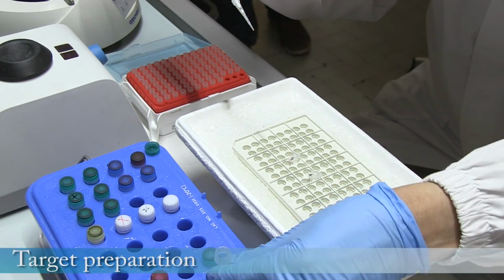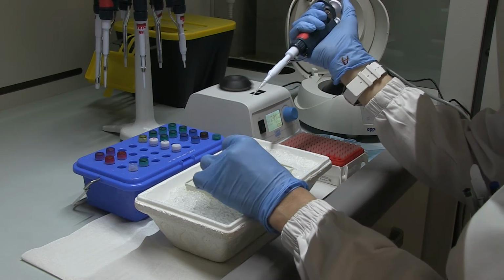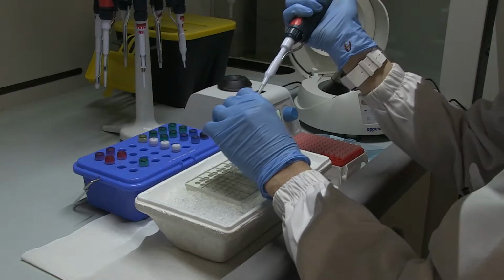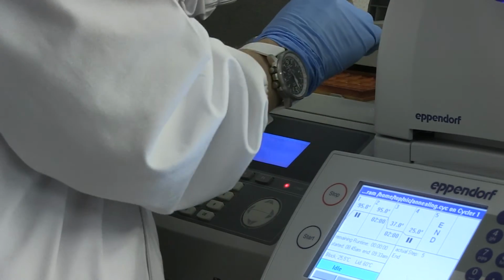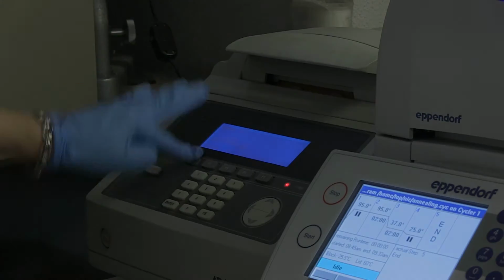The first step of target preparation is the synthesis of the first strand of cDNA. 100 nanograms of RNA are used in this step. The reaction mixture is incubated in a thermocycler.